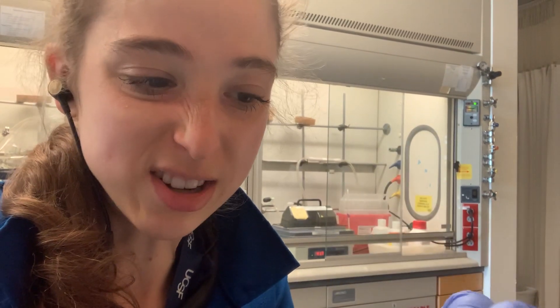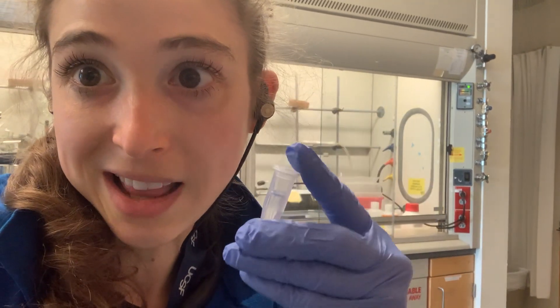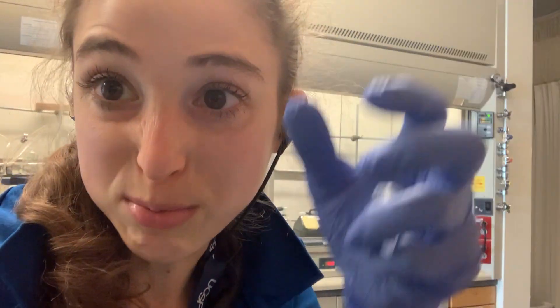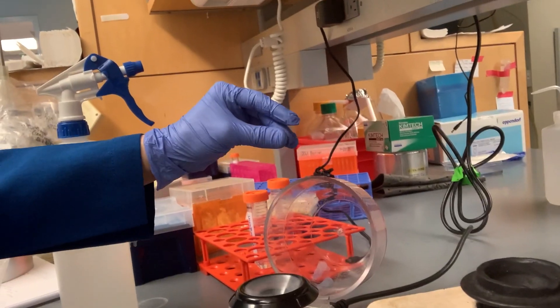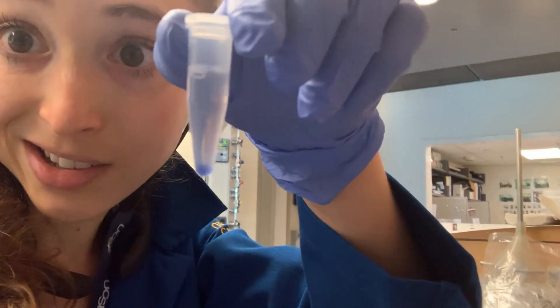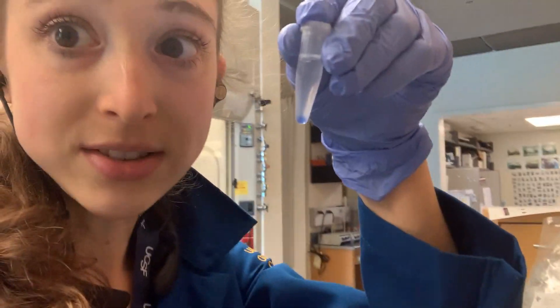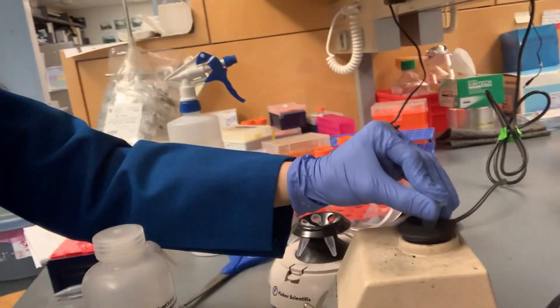This is why we use centrifugation to separate things — like when we're pelleting out things, we want to get the membrane gunk out of a cell lysate. If we stick something in the centrifuge, it's just going to pull everything down, whereas with the vortex we're actually spinning things up and mixing them together rather than separating them by weight. You can see here — this is just still stuck at the bottom.